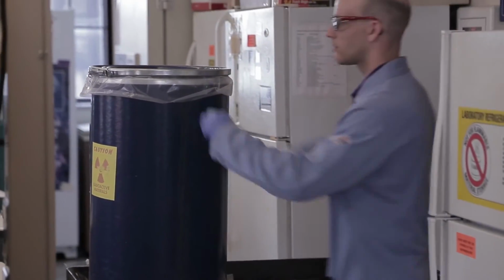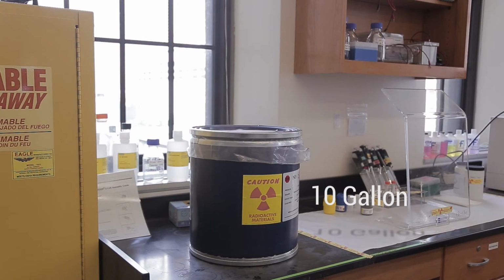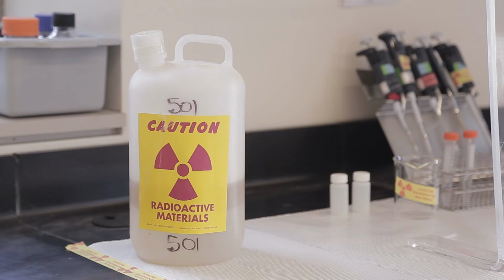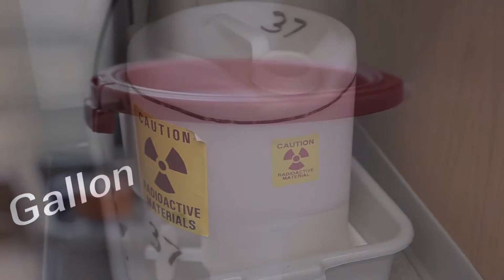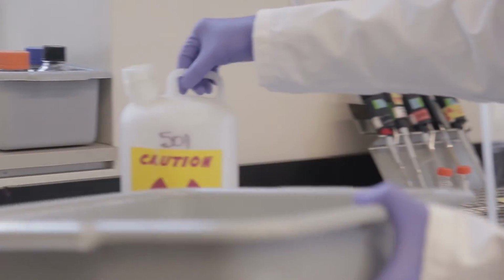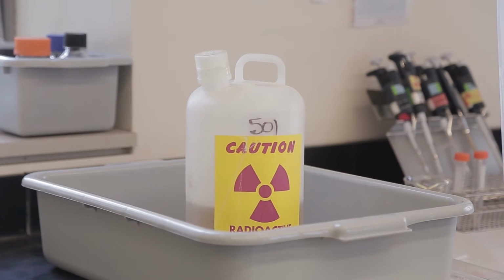ORS provides a variety of standard radioactive waste containers at no charge. Available containers include dry waste containers. These fiberboard containers are available in 10-gallon and 22-gallon sizes. Aqueous waste containers. These plastic containers are available in 1-gallon and 5-gallon sizes. ORS will provide a funnel for use with your aqueous waste container. Similar to liquid chemical waste, all liquid radioactive waste must be kept closed, sealed, and in secondary containment.